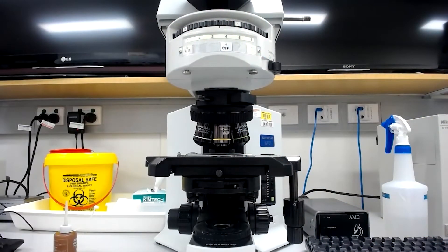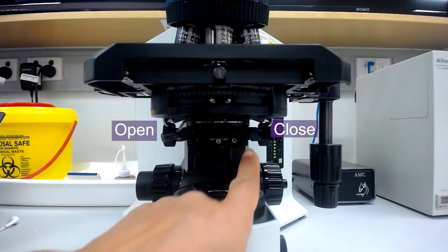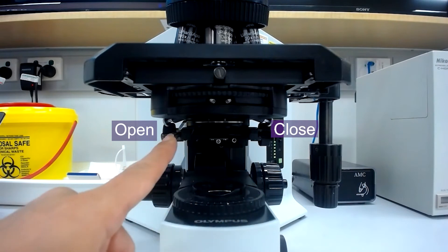Check the numerical aperture of your objective and narrow the aperture of the condenser to around three quarters of this value.